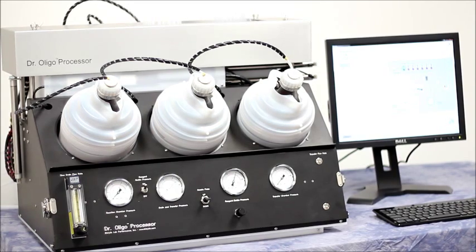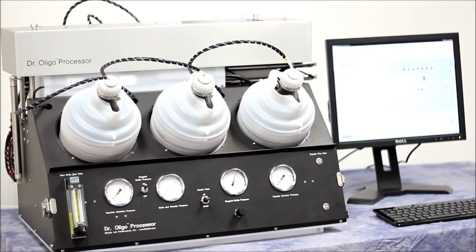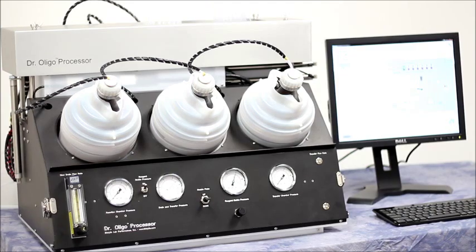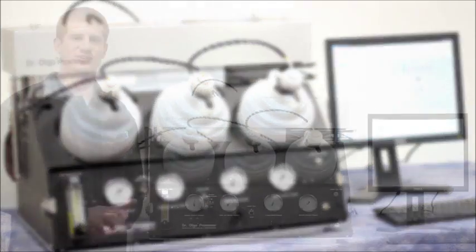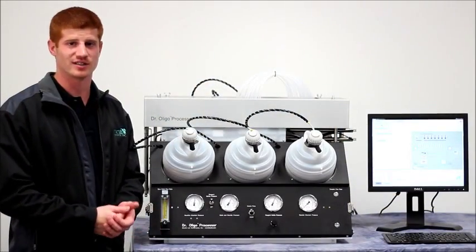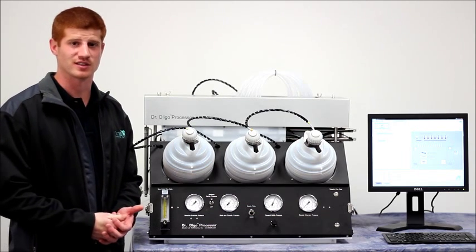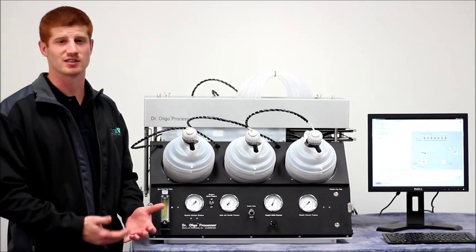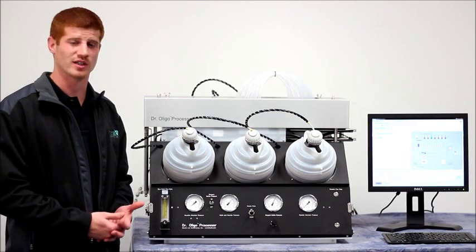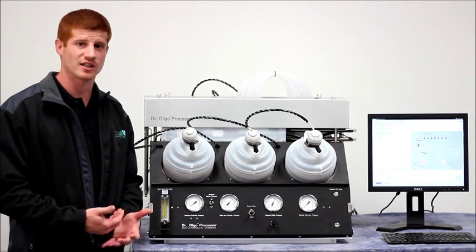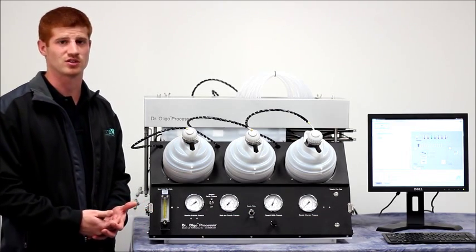Now that sound that you just heard was the clamps actuating to begin the drain process to drain the waste. The remainder of the process just includes various dispensing of the remaining reagents into the reaction plate and the subsequent draining of those reagents to waste. This is all specified in the protocol for whichever procedure you're trying to run.